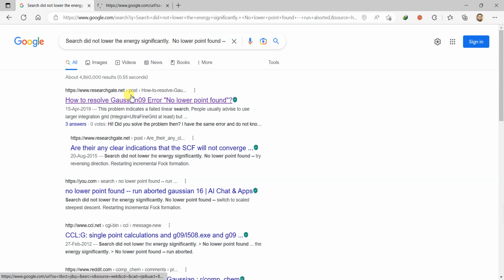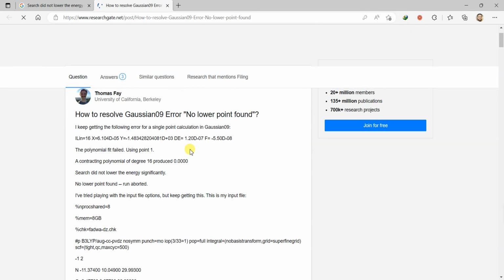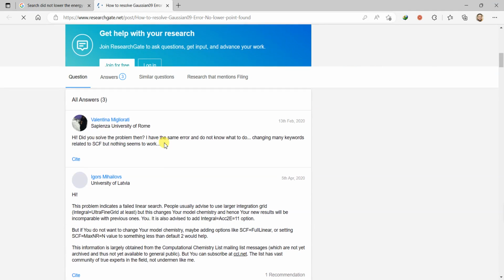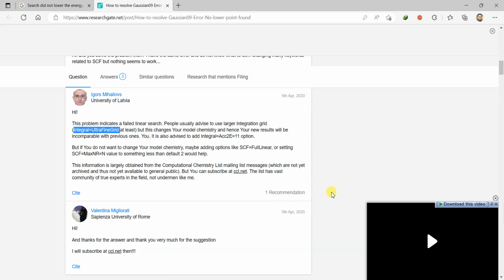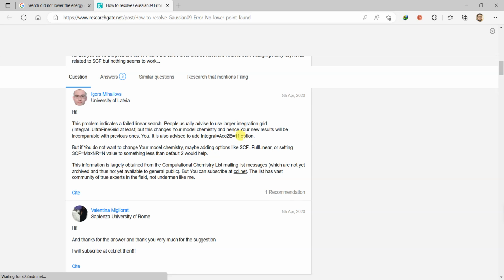Let's open this link and see that someone else has also got this error and posted it on ResearchGate, and many people have also answered it over there. Sometimes this problem indicates a failed linear search. People usually advise to use a larger integration grid. You can use this ultrafine grid, or you can also have other options. It is also advised to add the integral option. But if you don't want to change your model chemistry, maybe adding options like SCF=fullLinear or setting the maximum number to a different value may help. So either you can increase the SCF iterations number, or you can use a finer grid, or you can add these options to your route card, and then you can run this calculation to optimize it successfully.